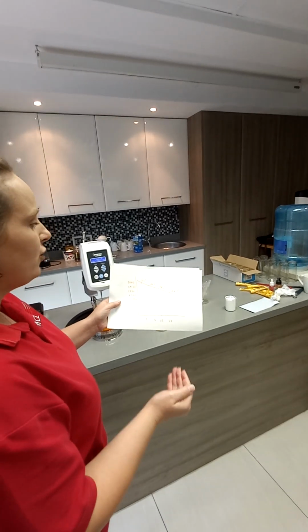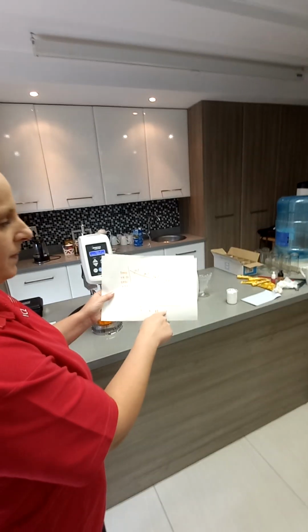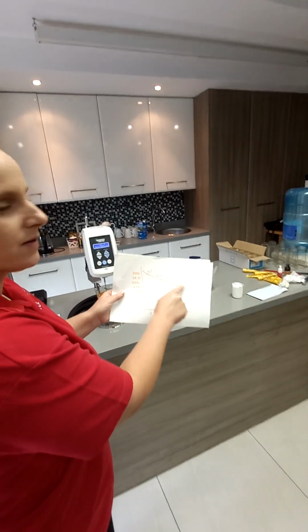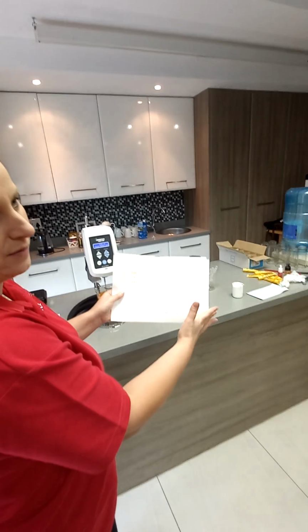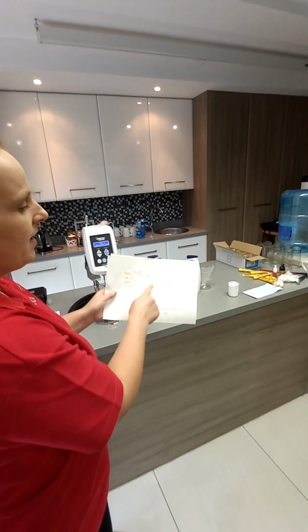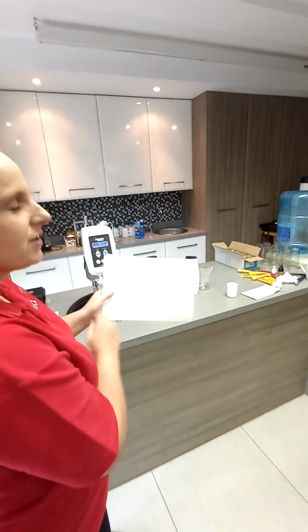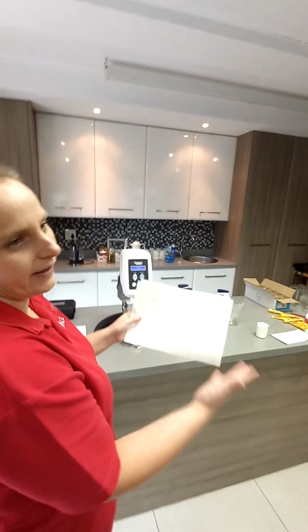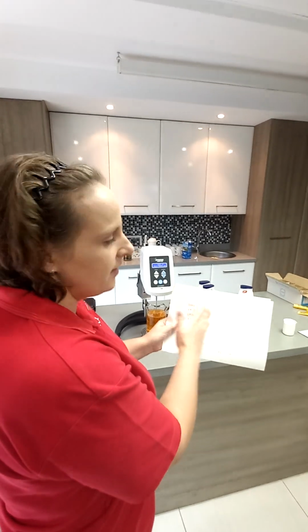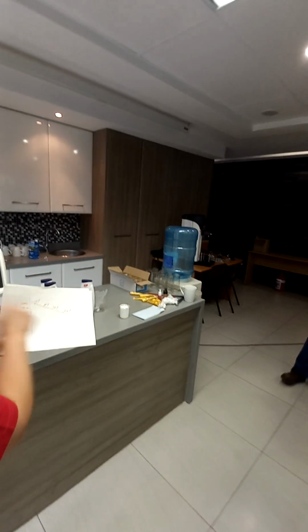Or you record it as 2770 using speed 20, spindle 5. They are all fine because the torque was between 10 and 100%. For QC checks, if I had to choose my spec, I would go somewhere closer to 50% torque. Because then if your sample is thinner or thicker the next time, you've got some torque room to play with. You don't want to be close to 10, you don't want to be close to 100. Okay, so all these values are fine.